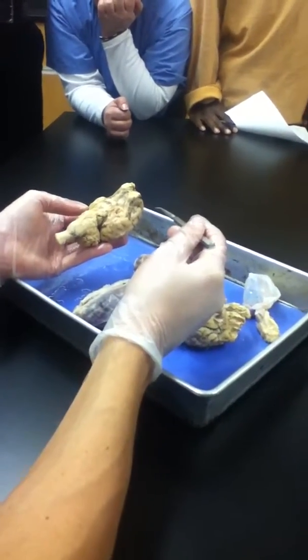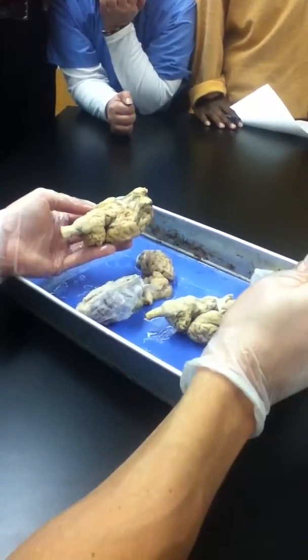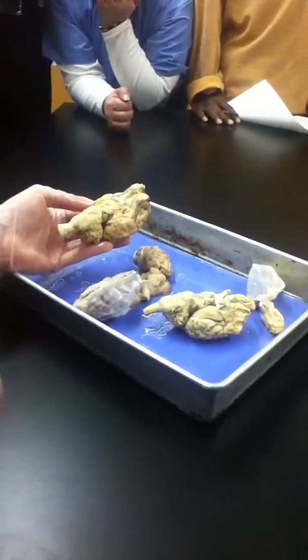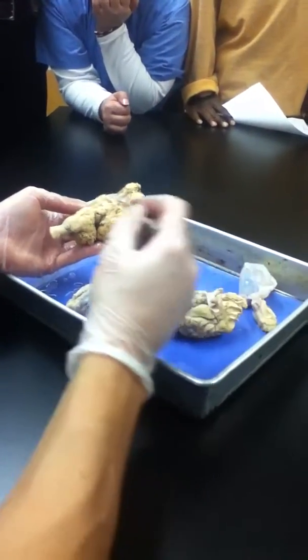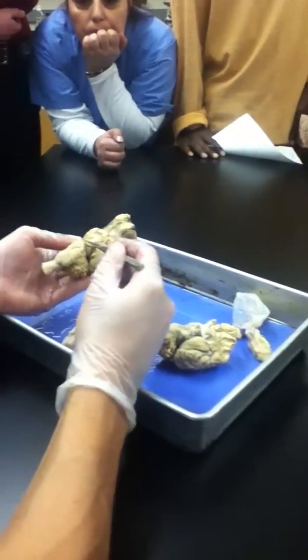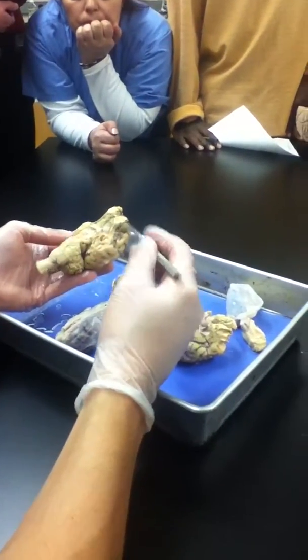You have to know all 12 on plastic brain models, but only number 1, the olfactory bulb and tract, and the crisscrossing structures here from the optic nerves forming the chiasma are all I'd ask on the sheep brain for cranial nerves. There's 12 of them to know, but only the first 2 do I ask on the sheep brain. The rest are also small. There are these tiny little cranial nerves right here, and they're just not worth asking, in my opinion, on a brain where they're so small and dried out. All right, so that's everything from this angle.